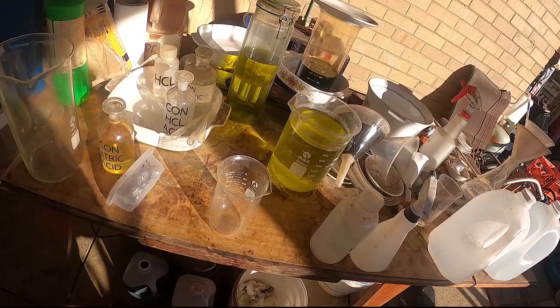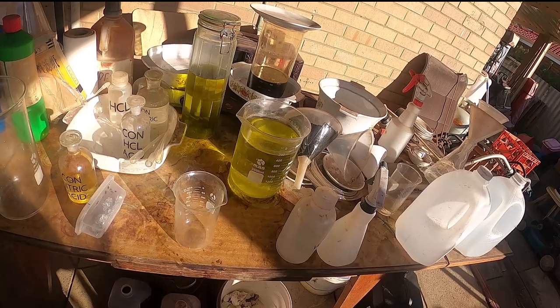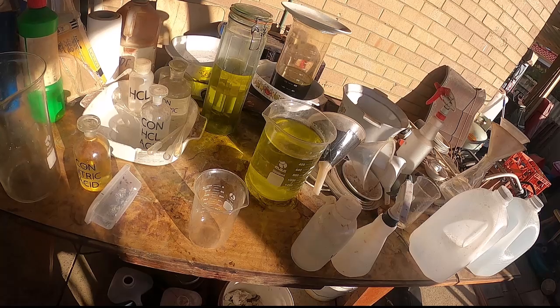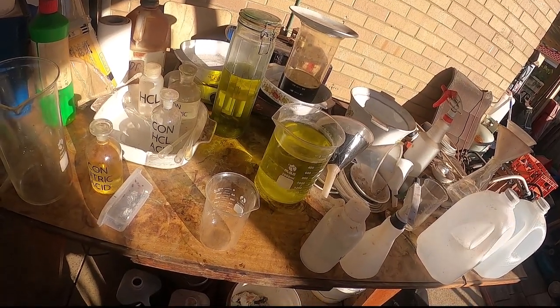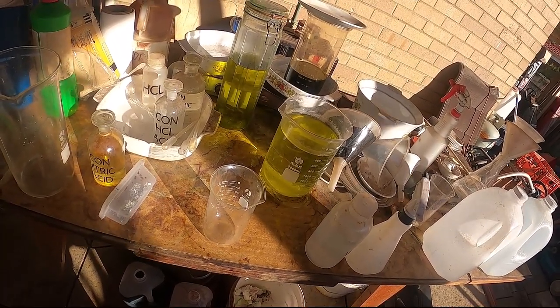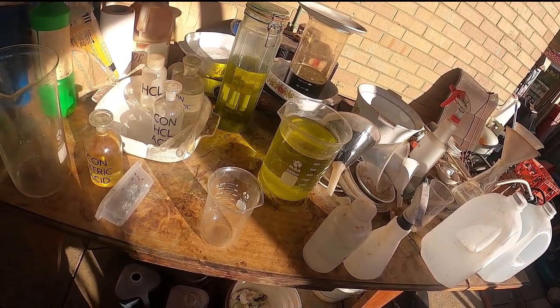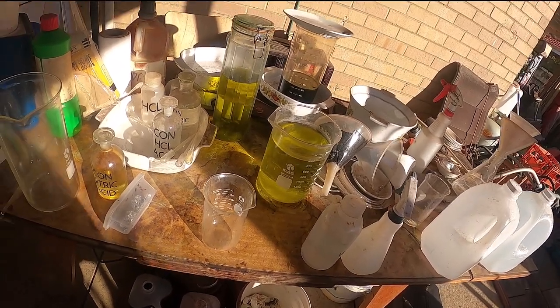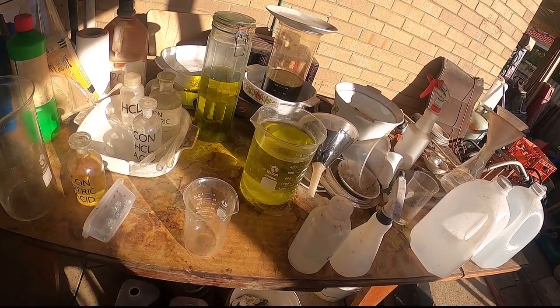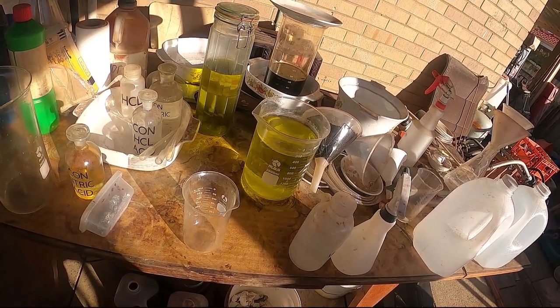G'day viewers. I was asked by one of my viewers to show how I make stannous chloride. I thought it was a bit strange since there are so many videos out there and I've even made one myself in the past, but what you guys want, you guys get — there would be no channel without you guys. It's really simple to make. Basically, anytime you soak anything in hydrochloric acid to remove tin from boards, you've made stannous chloride.